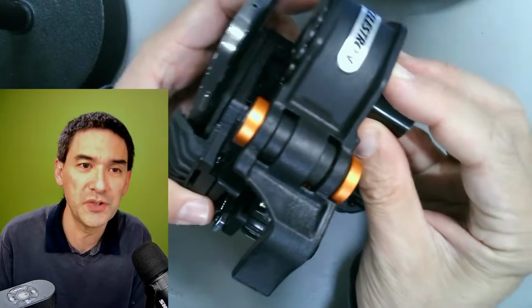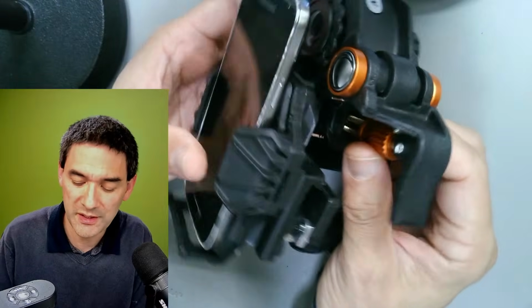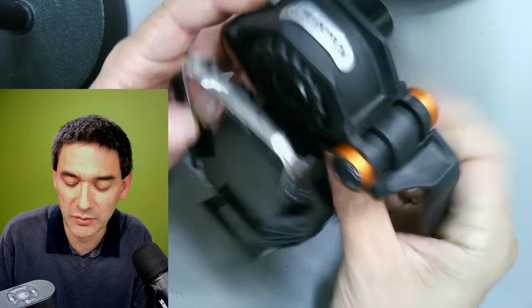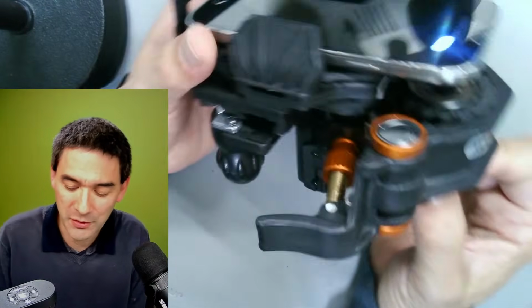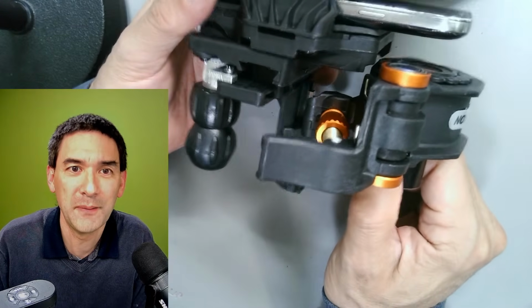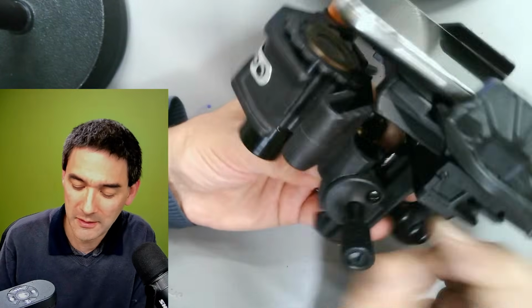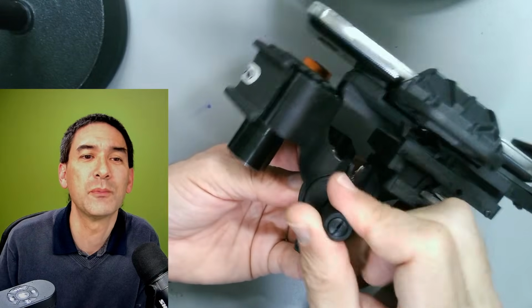And because of course this is not very stable, obviously, for this reason you tighten it by turning the screw here. And this really clamps it all the way in. Now, this one allows you to adjust the position of the camera in almost all dimensions. You've got over here, you can raise it and lower it. Okay, so that's number one.